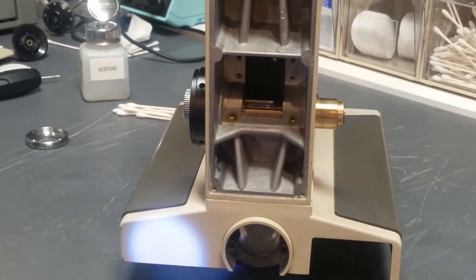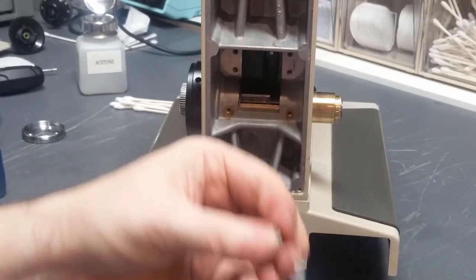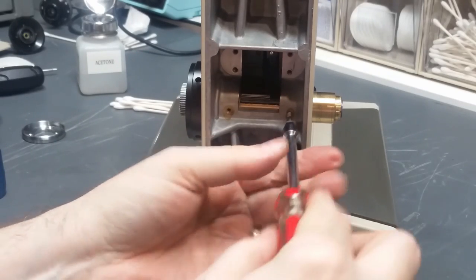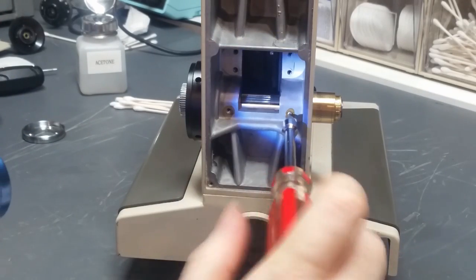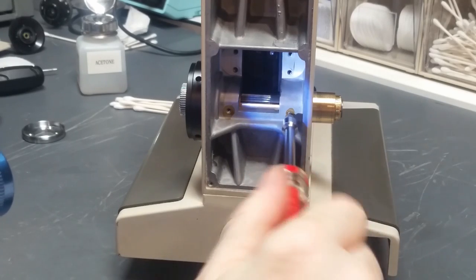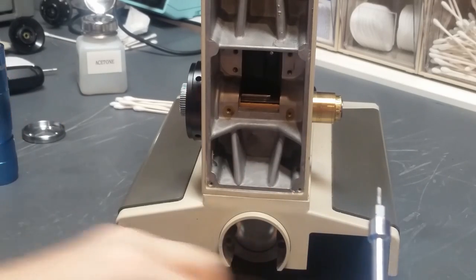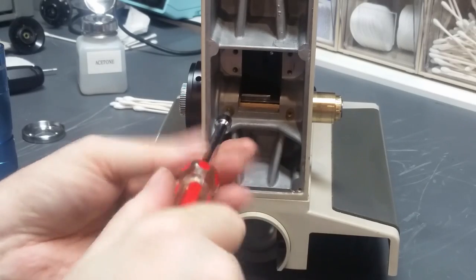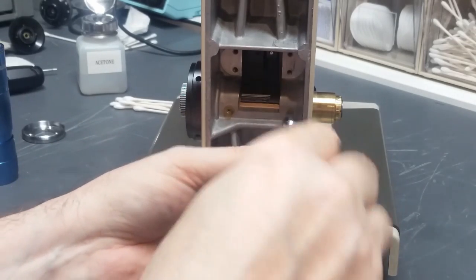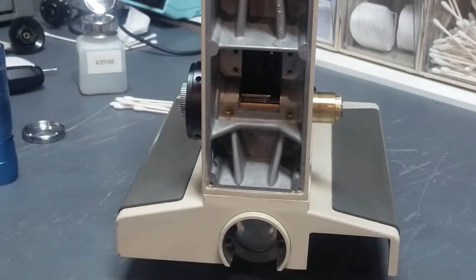Okay, so that looks like it's pretty well aligned. I've got a couple set screws, I'm ready to put those in. With any luck, when that goes in, yeah, you'll see the whole thing moved just a little bit as it bit into that depression, so it's aligned properly now. And I can set the second one in. Snug these down a little bit. I don't have to go crazy with them. But yeah, at this point, that baby's installed properly.